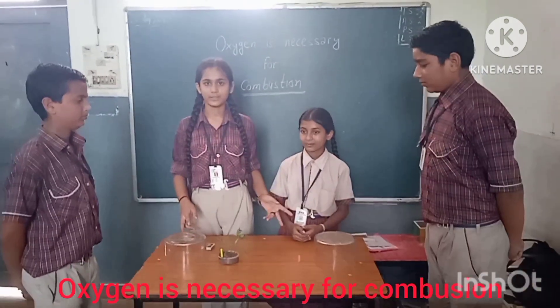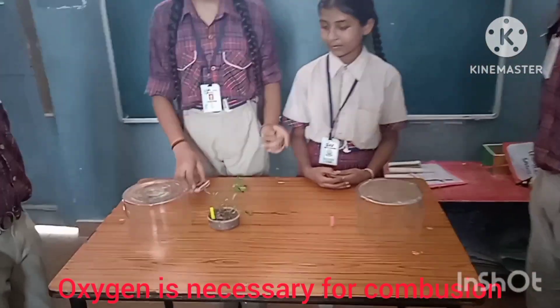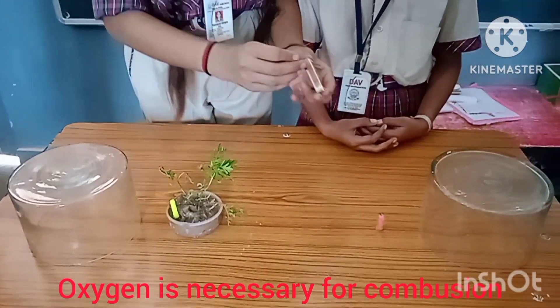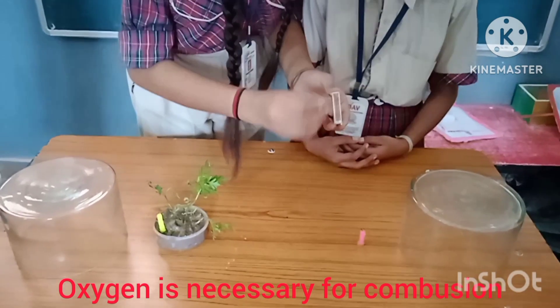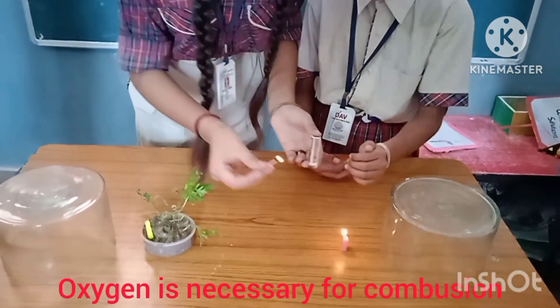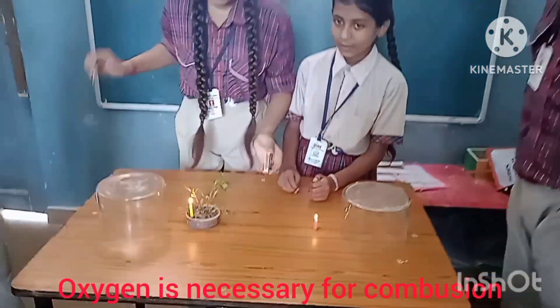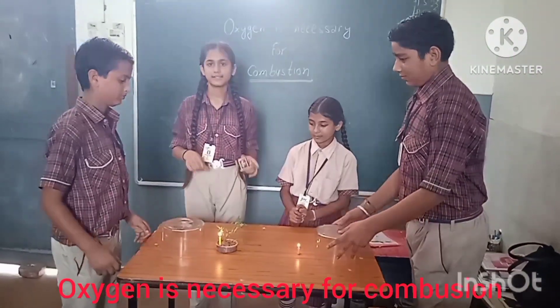For this we need 2 beakers, a candle, and a plant. First of all, we have to burn the candles, and then place both beakers on them at the same time.